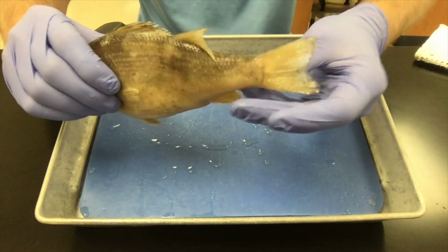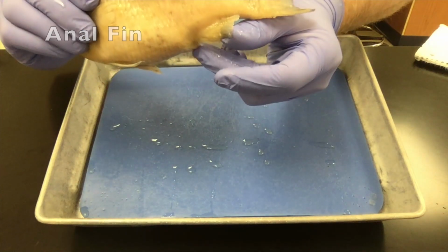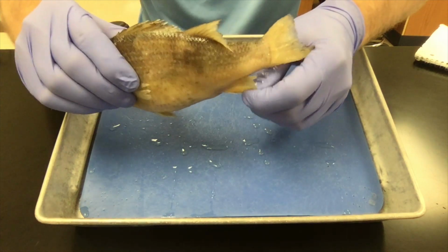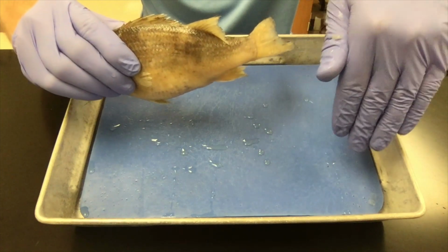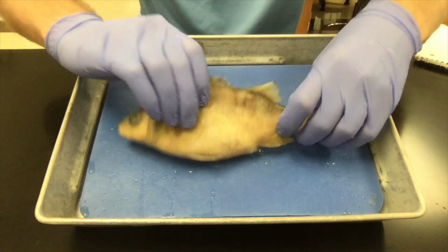Finally, in the back is the anal fin. It's called the anal fin because it's right next to the fish butt. On the fish, the butt is called the vent. The anal fin is sort of like if you've ever seen a surfboard and they have the little things going straight down into the water on the back of the surfboard that help it to move straight. That's what the anal fin is used for.